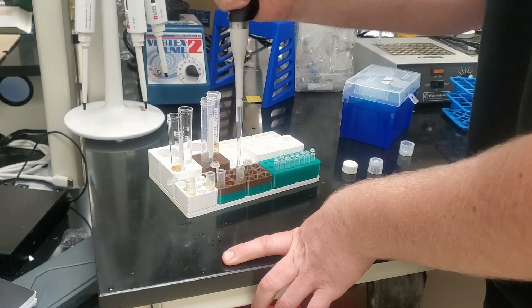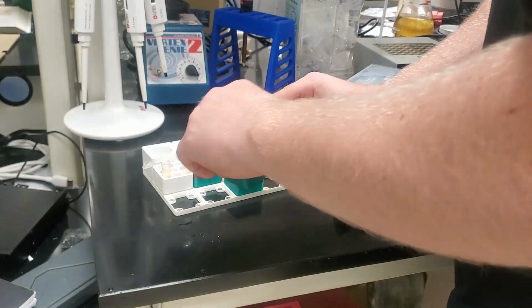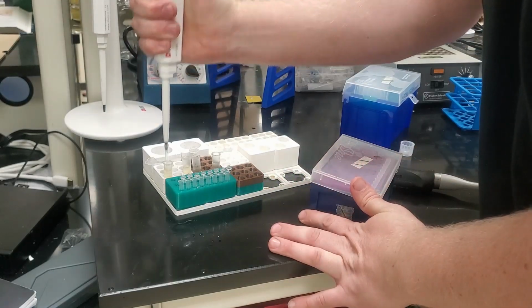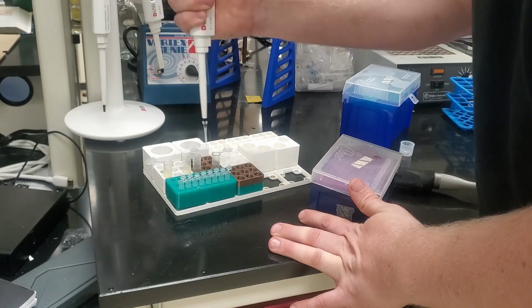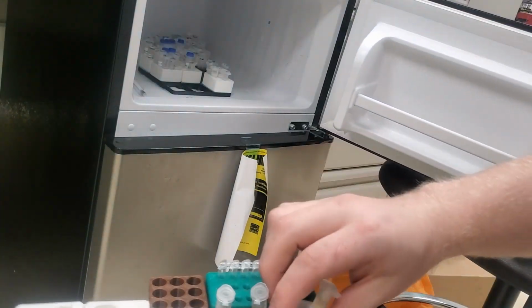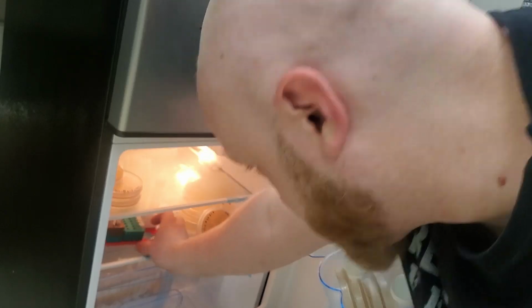And once I'm done with preparation and need to move on to the next experiment, I'm able to immediately rearrange my whole rack, be all set up, and start loading the next style of tube. And seriously, I do mean practical. It's taken me a while to get this video out, and while I've been working with this, I have essentially turned my entire laboratory workspace into a Gridfinity-based ecosystem, entirely based around using modular tube rack pieces.